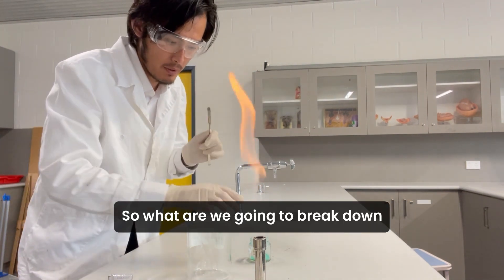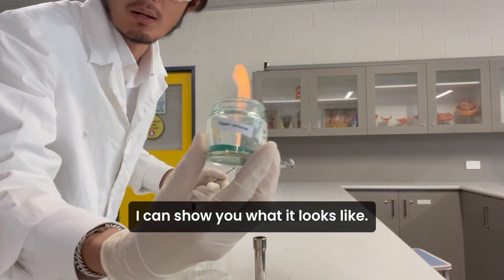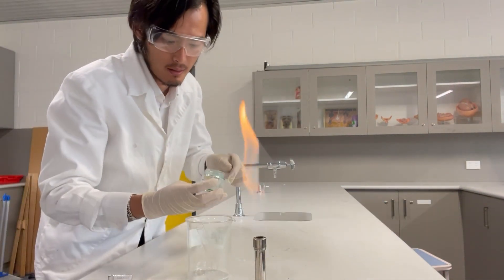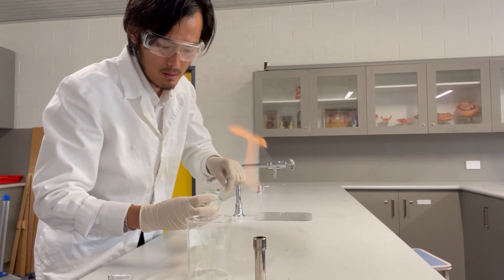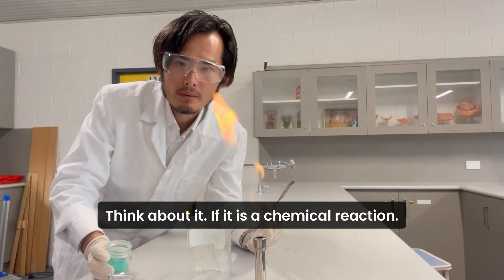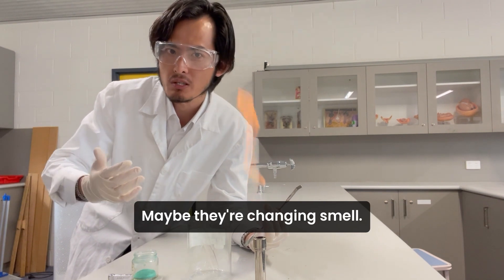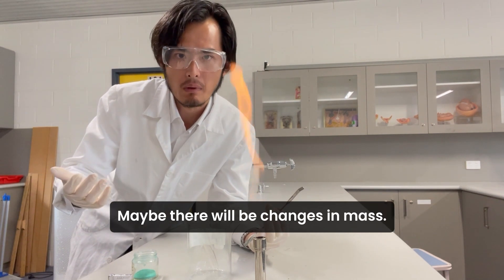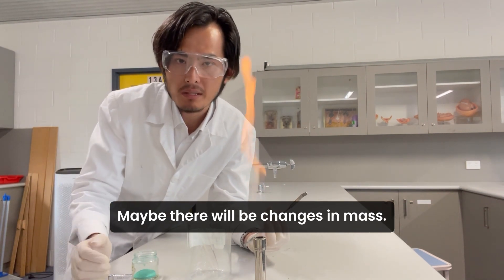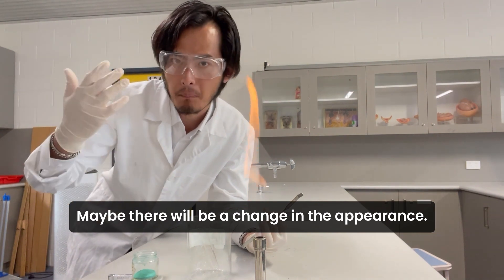So what we're going to break down today — we have copper carbonate. This is what it looks like; it's a greenish color. Think about what will happen if it's a chemical reaction: maybe there will be a change in smell, maybe a change in mass, maybe a change in appearance.